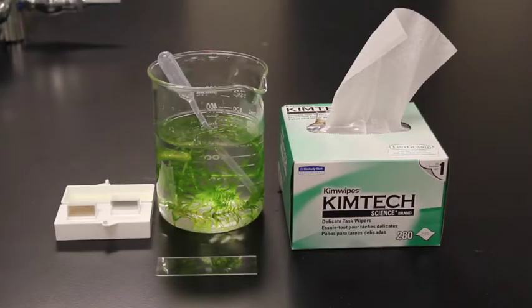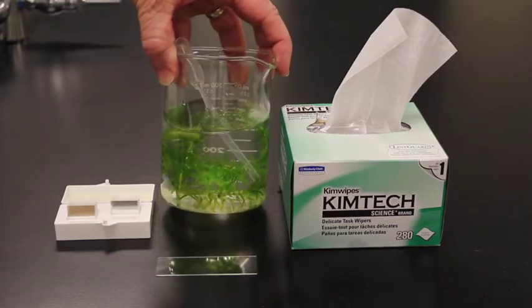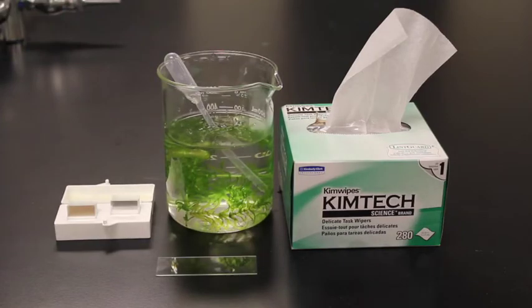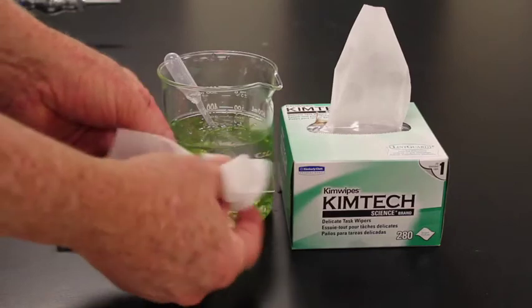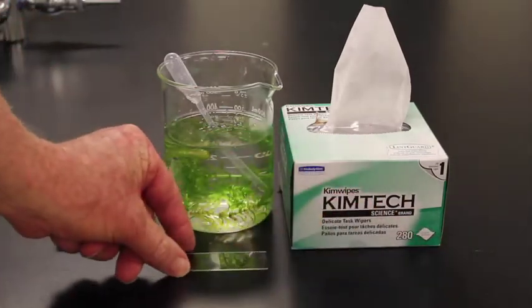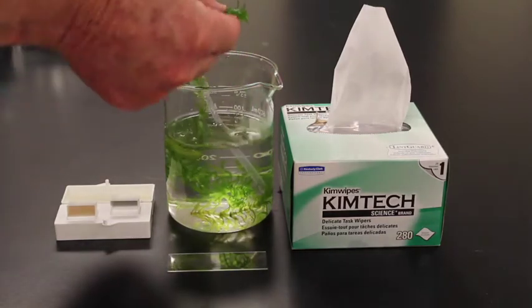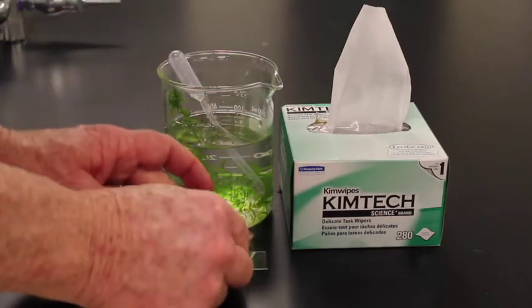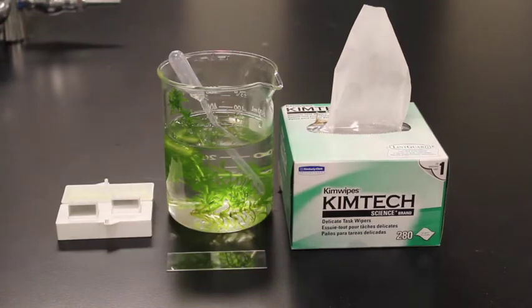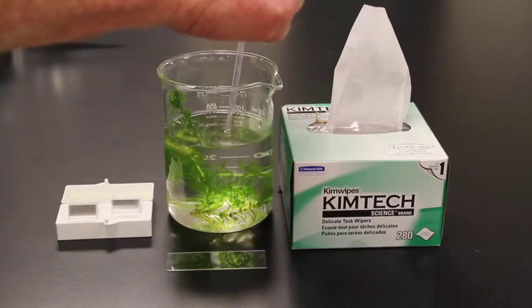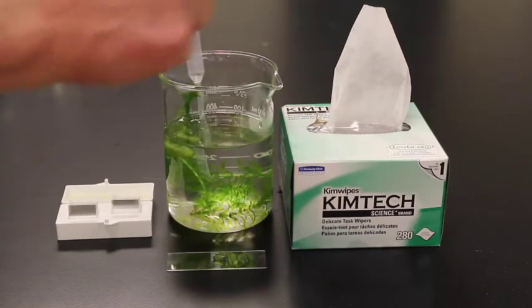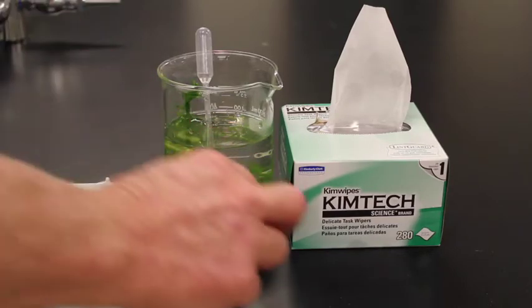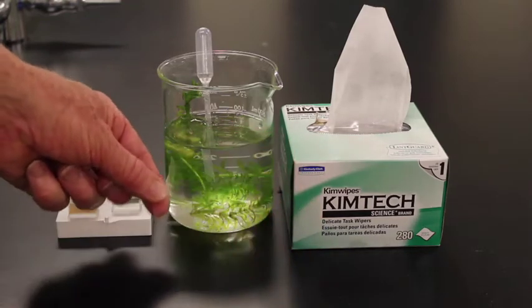The first technique we want to do is a wet mount. To do the wet mount, we're going to use it to look at plant cells. So our plant cells are going to be off of the leaves of this plant, which is Elodea densa. The first step is to take a Kimwipe, make sure that my microscope slide is totally clean. So I'm going to clean off that microscope slide really well. Then I'm going to reach in here. We want a teeny tiny leaf off the top. I just want one leaf. We'll put it down and stick it down on there. Now I'm going to take my eyedropper, get a drop of water, put that right on top there. I'm going to grab a cover slip and gently put the cover slip down on top. And here is our wet mount all ready to go.